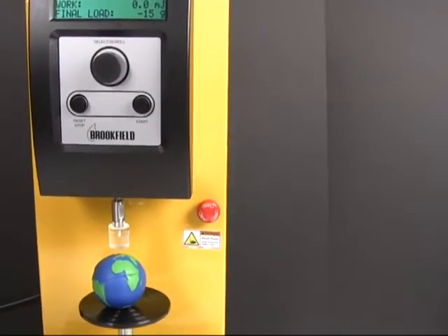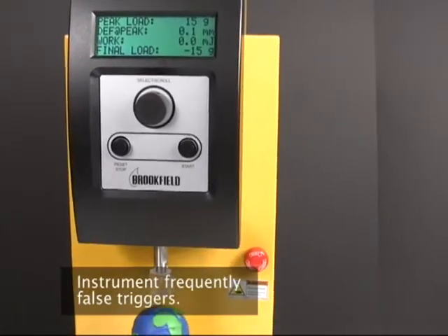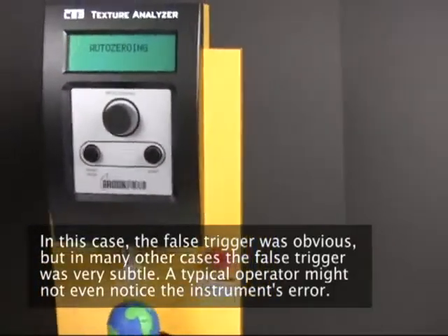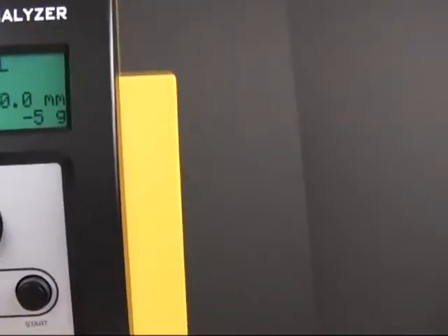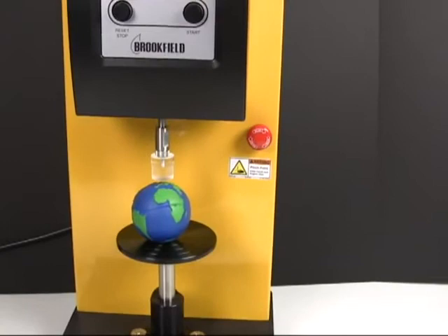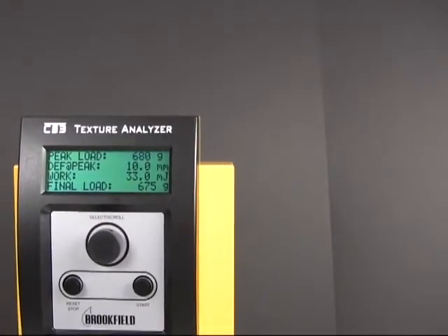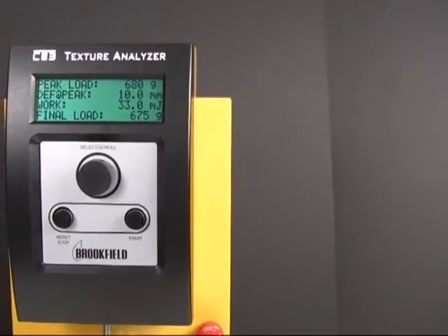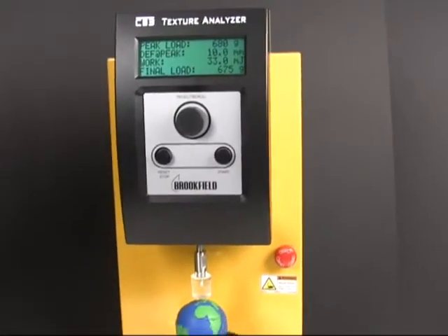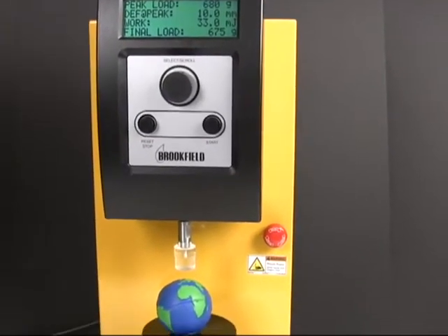That's not supposed to be what it showed. Let me do that again — that's no good. There we go. Four tests and at least two of them are similar. That's not great odds, but could be worse, I guess. I'm going to let this finish first of all. It'll finish sometime today.